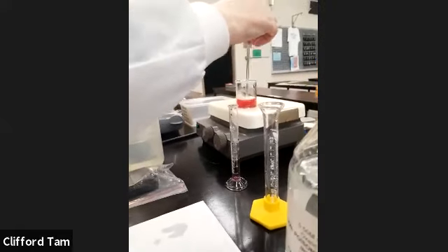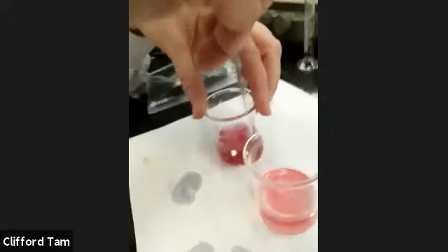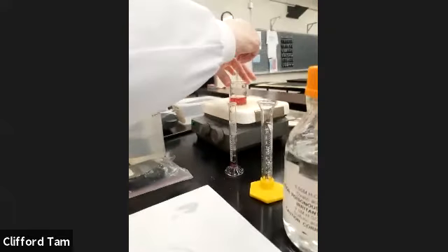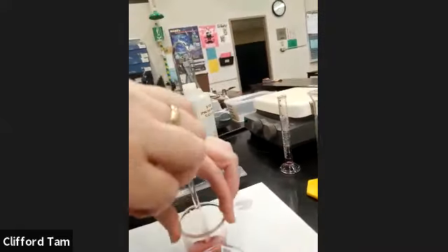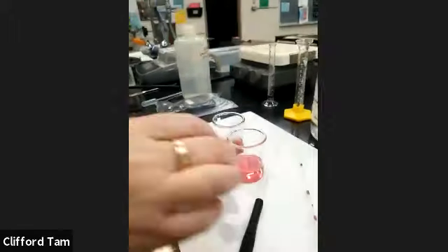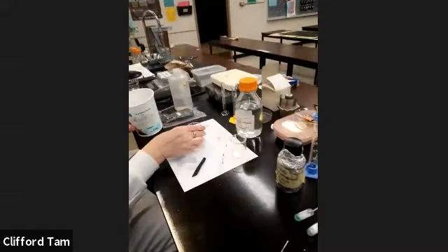And there you have it, folks. We are now at what time, Xantha? We are at 1 minute. So it's about 4 minutes and 30 seconds. We already have this red color here, so you can see the effect that temperature has. It increases the speed significantly, and therefore increases the rate. They're about the same color now. Perfect. Thank you so much, Xantha. Okay, so we're now going to look for the last one momentarily.